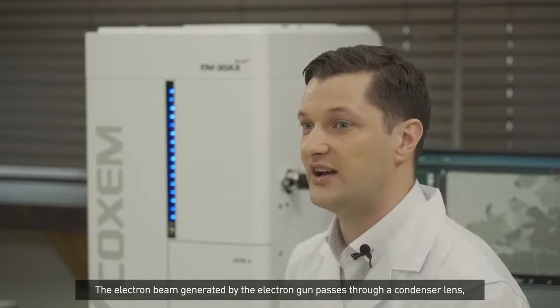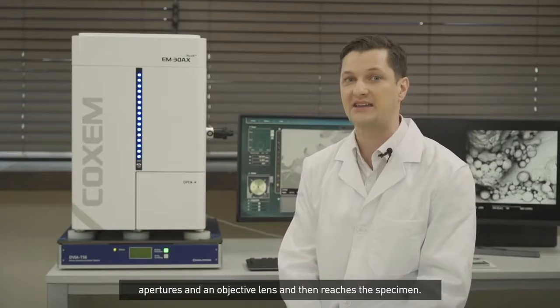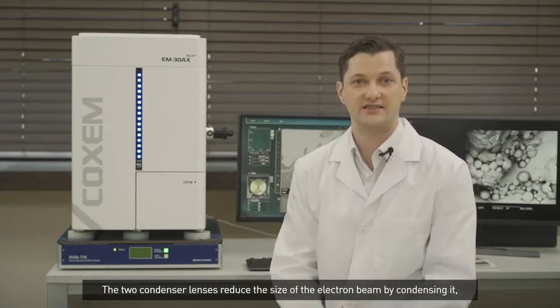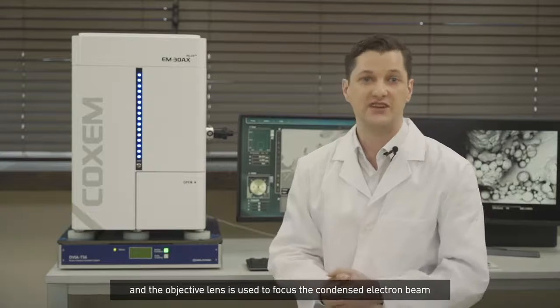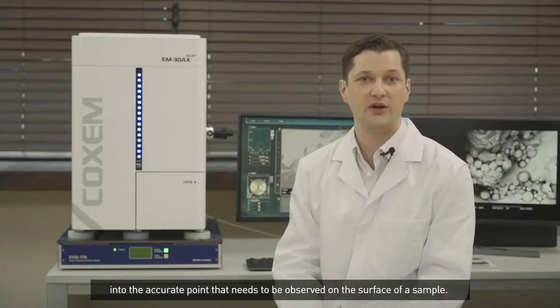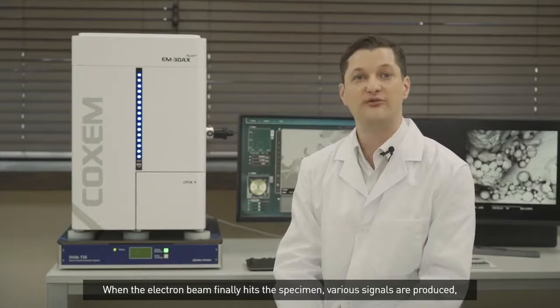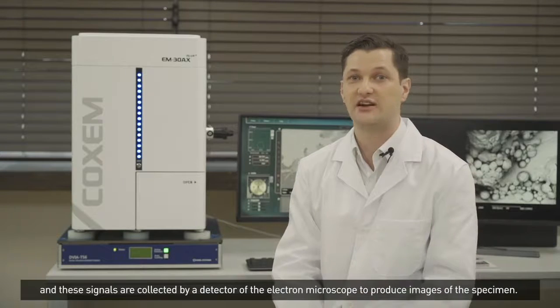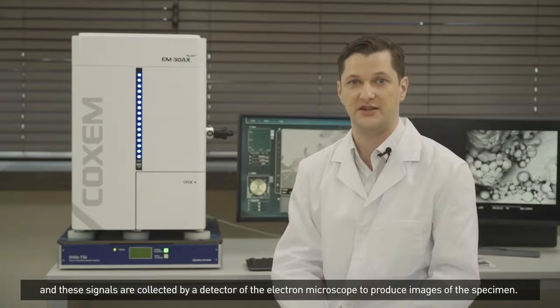The electron beam generated by the electron gun passes through a condenser lens, apertures, and an objective lens, and then reaches the specimen. The two condenser lenses reduce the size of the electron beam by condensing it, and the objective lens is used to focus the condensed electron beam into the accurate point that needs to be observed on the surface of the sample. When the electron beam finally hits the specimen, various signals are produced, and these signals are collected by a detector of the electron microscope to produce images of the specimen.